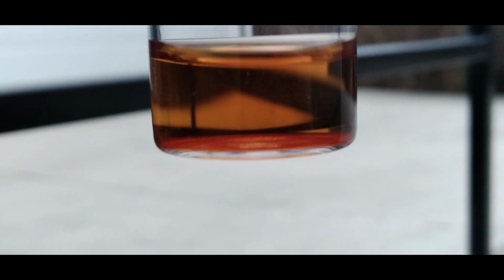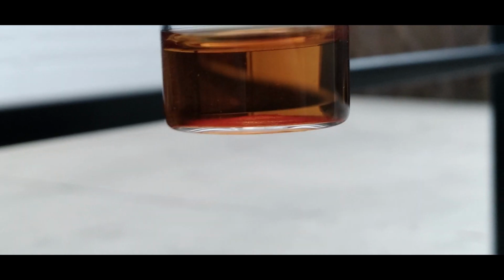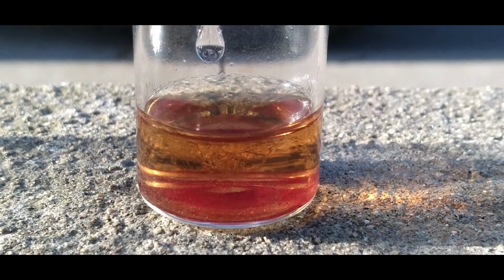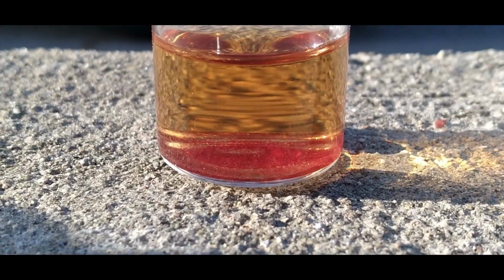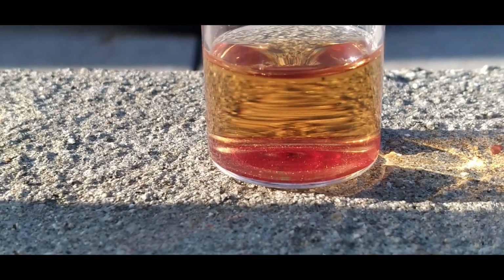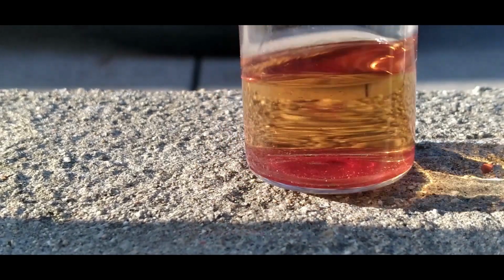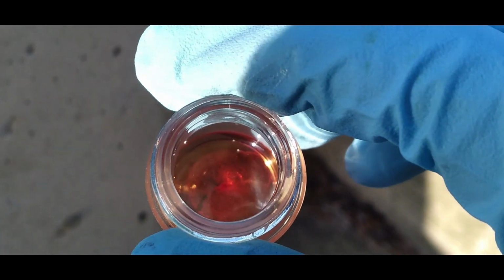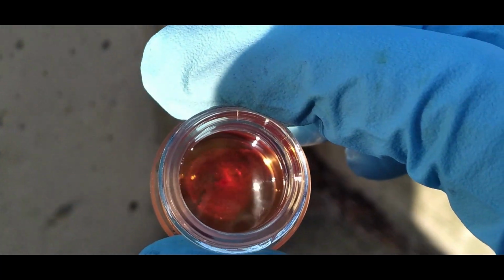Oh my god, you can see it forming at the bottom. That is ammonium hexachloroosmate. I tried everything I could to extract every last particle of ammonium hexachloroosmate from this solution. But as it turned out, there just wasn't enough sodium hexachloroosmate in solution to precipitate any more. Although I'm a little disappointed with how little I was able to make, I still made ammonium hexachloroosmate, and it's definitely enough for you to see the vibrant red color it has.